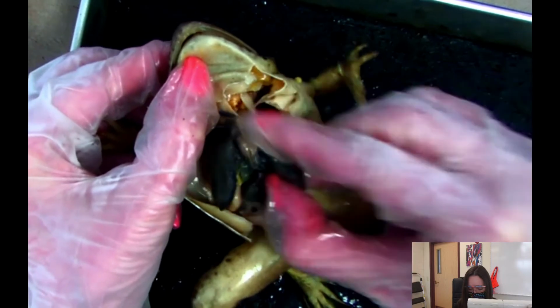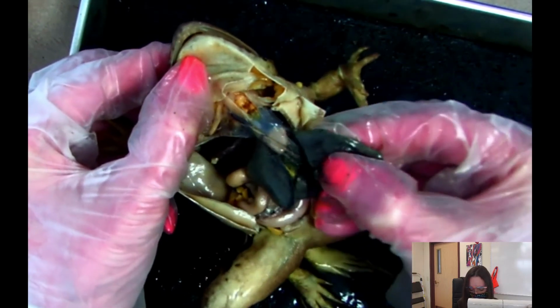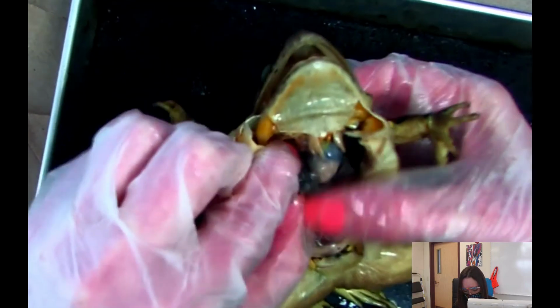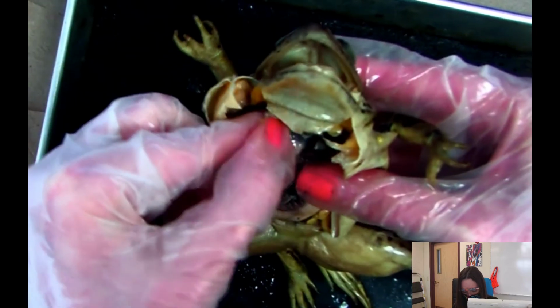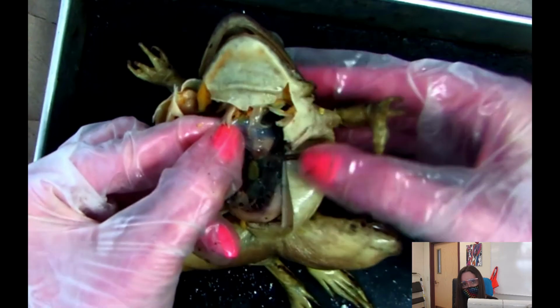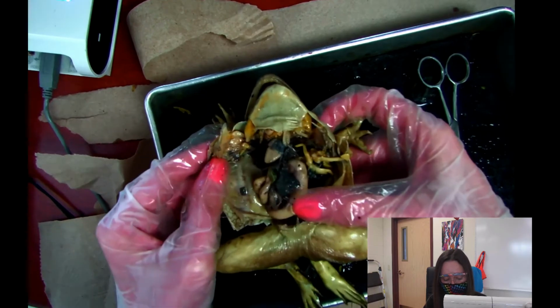So you're going to kind of take things apart if you're dissecting in class. There's a lot of connective tissue here. So it's not too easy to take it off. But the next thing I actually want to show you that's easy to see. In fact, I'm actually going to go into a transition because I'm going to get rid of some of this connective tissue. So let's go ahead and do that. Okay, so I think I made this a little bit easier.